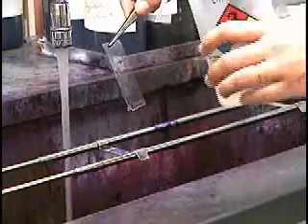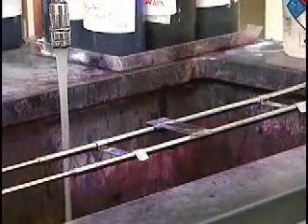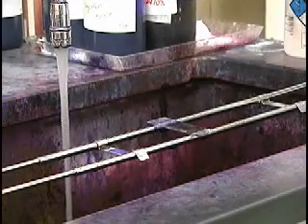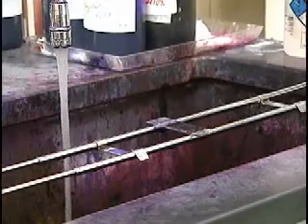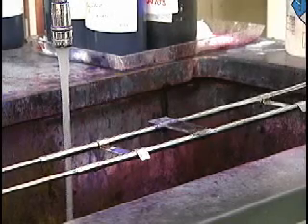Then we decolorize with an alcohol — we use acetone for 2 to 3 seconds. This is an important step for removing excess crystal violet from the slide, and also a fundamental step in determining whether an organism will turn blue or turn pink. Thick-walled bacteria that turn out to be gram-positive retain the crystal violet complex in their thick cell wall. If you don't have a thick cell wall, the acetone will remove the stain from the bacterial cell wall, leaving it with no stain at that point.